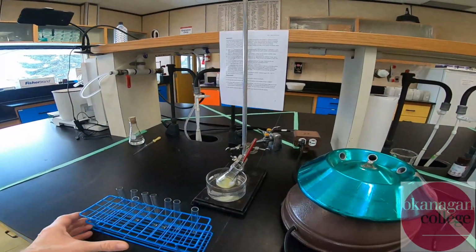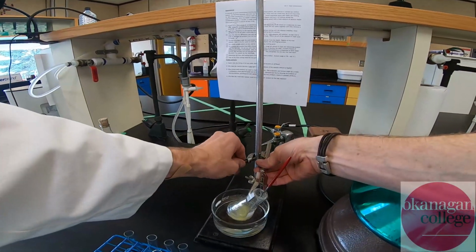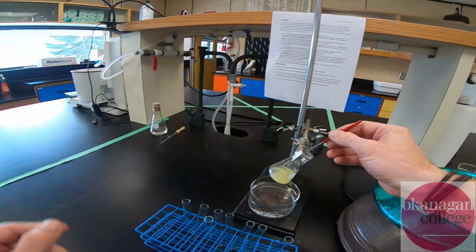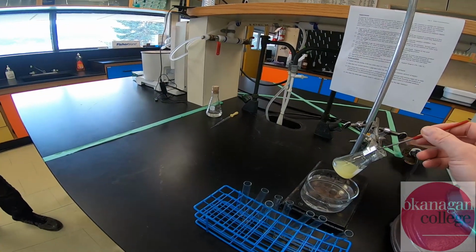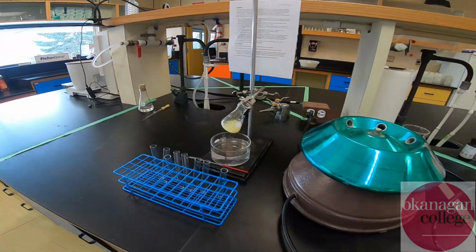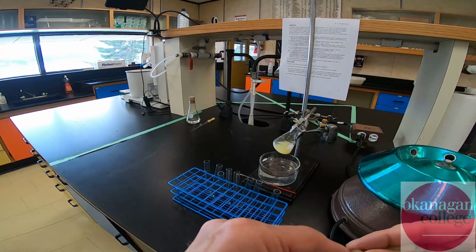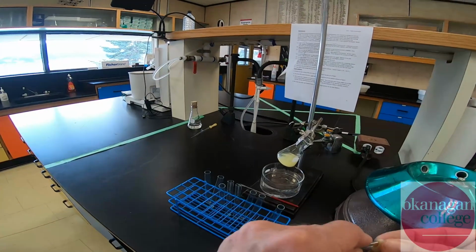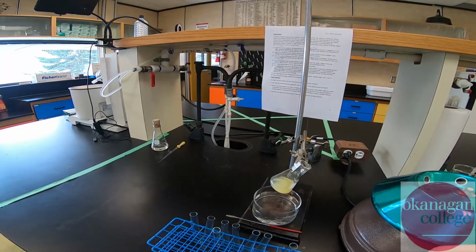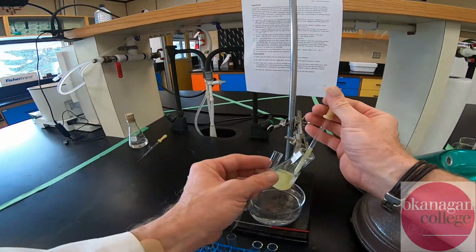Okay, so things have settled for probably 10-15 minutes in an ice bath, maybe a little longer than we needed to. On close examination of the solid, it is extremely fine. From experience, if we try to filter this, it'll probably be met with frustration. It will just clog the filter and we'll be stuck watching it. So choosing to be proactive here, we're going to transfer this into test tubes, and we're going to centrifuge it down and use the trick that we used in the initial step to try to isolate our material.